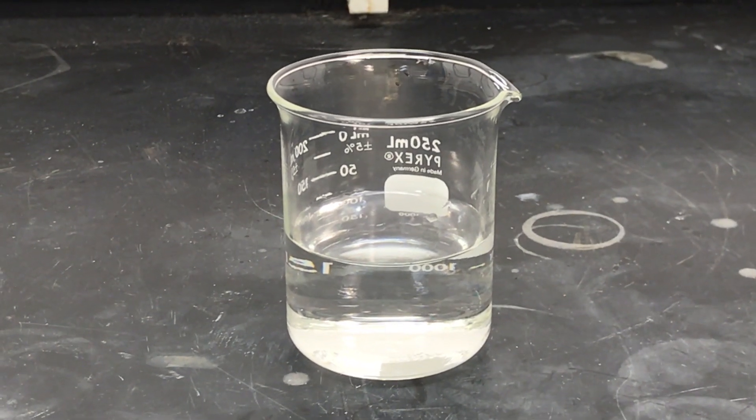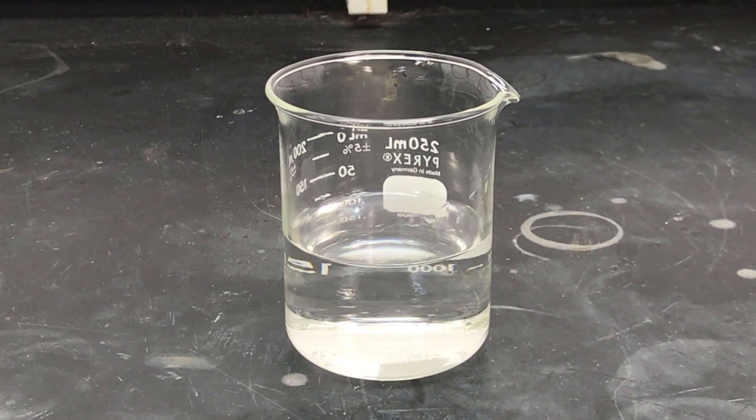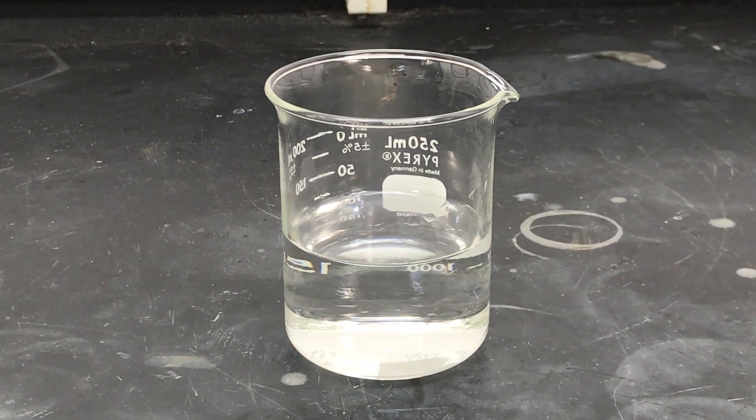Alkali metals reaction with water, sodium. I have here a beaker with some deionized water.